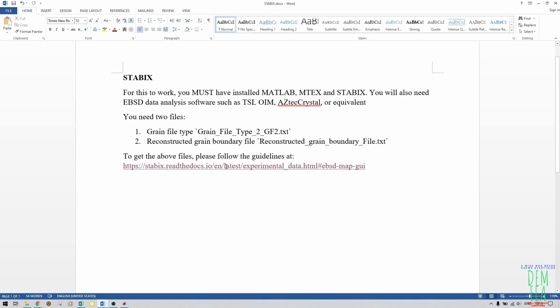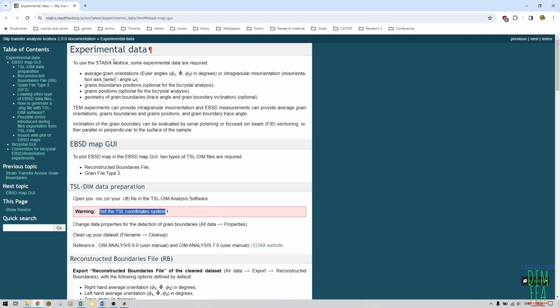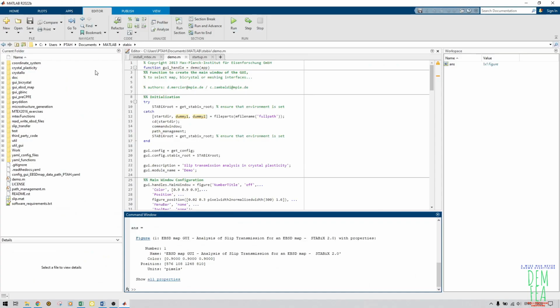To get the above files, you need to follow this link and these guidelines here. As you can see here, we have the experimental data. You can use your experimental data and the Stabix toolbox to analyze the slip transmission. When you're using TSL preparation, you must clean the files, and also you must set the TSL coordinate system. This is very important. As you will see, we need to set the coordinates before the analysis commences. For this to work, you must also have added Stabix and MTEX to your MATLAB path. I've already done that.